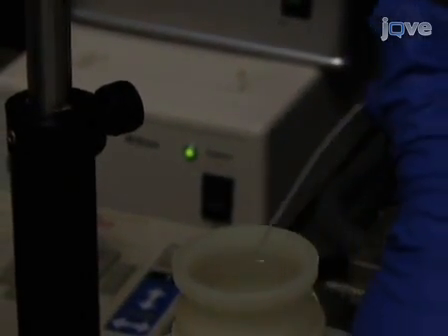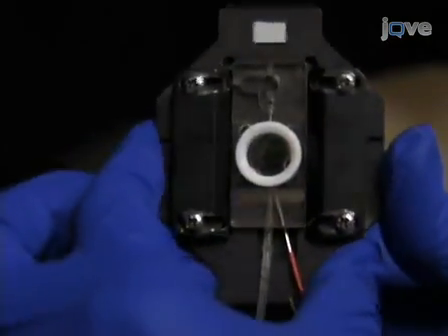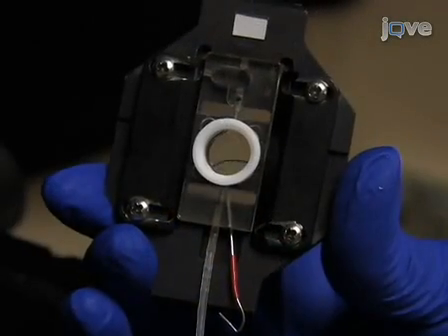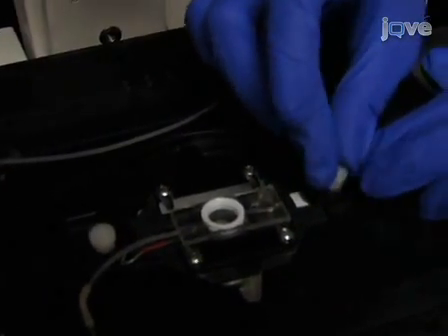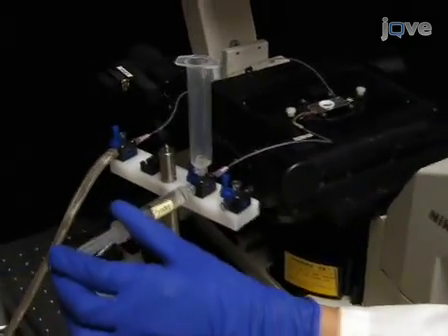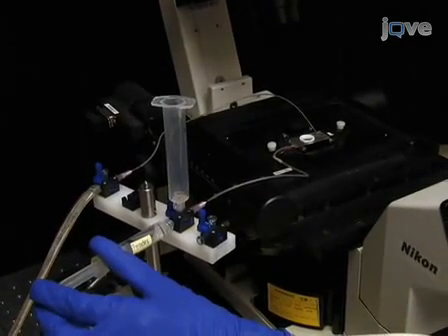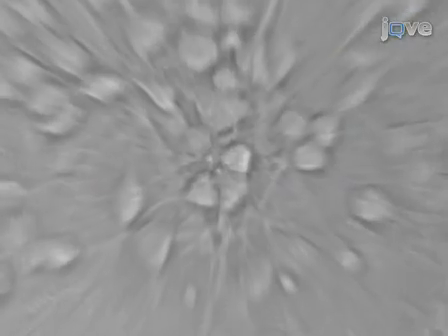Next, load the Tyrode solution into the input line, taking care to prevent the formation of air bubbles. Then connect the chamber to the input perfusion lines and perfuse Tyrode solution through the chamber. Perfuse slowly to avoid the formation of air bubbles in the chamber. Now secure the chamber on the microscope stage and install the output perfusion line, which is connected to a suction line. Apply the input solution to confirm that the perfusion lines are connected — you should hear the input solution being aspirated into the output line.